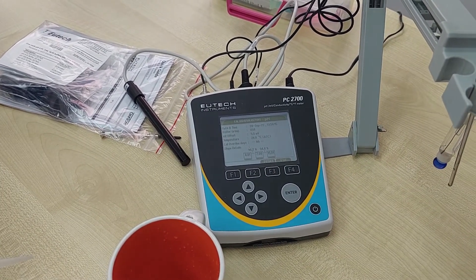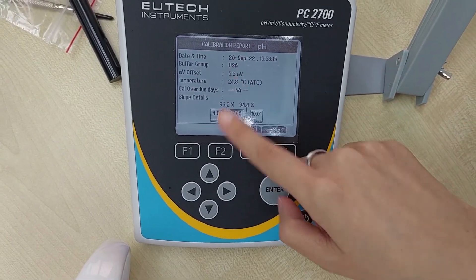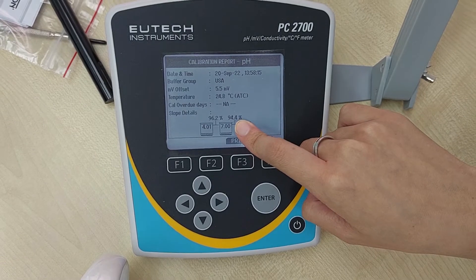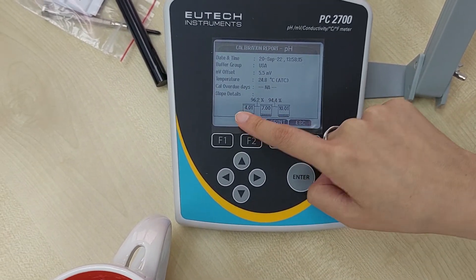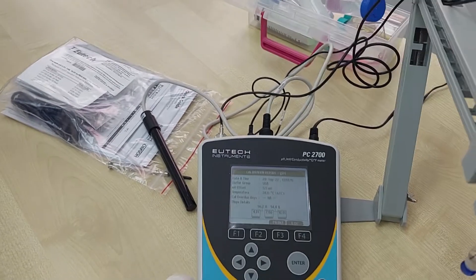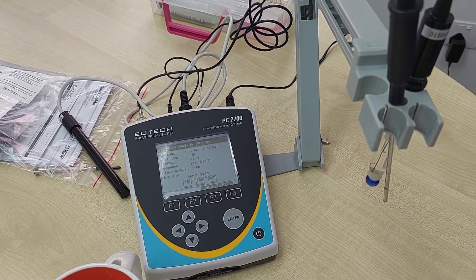You can see the calibration report shown on the screen. USA Standard: pH 4 to 7 is 96%, and pH 7 to 10 is 94.4%. A good electrode will be within 92 to 102%, so this means the electrode is in good condition. Next, we will proceed with conductivity.